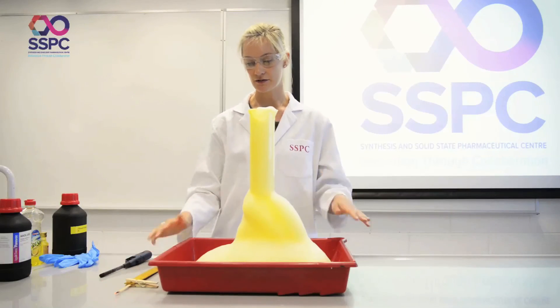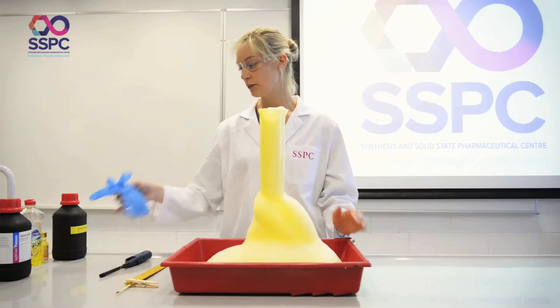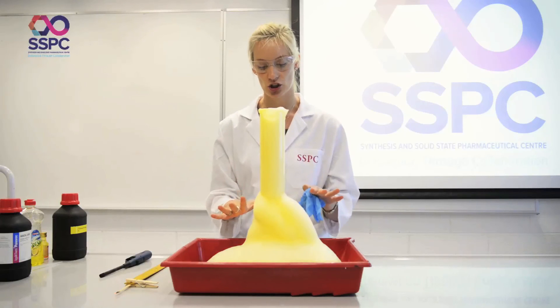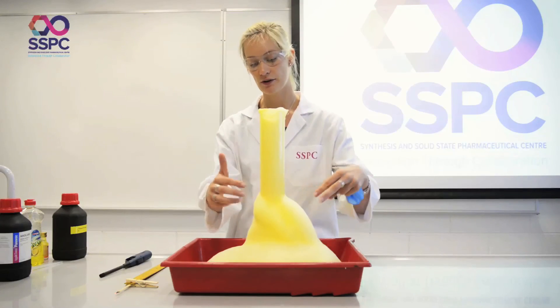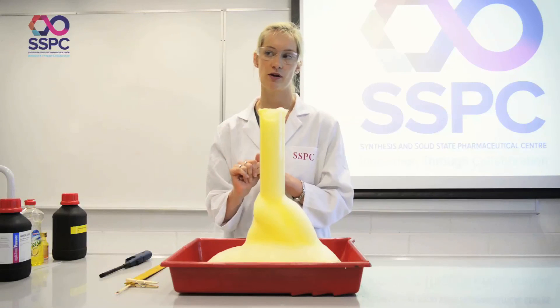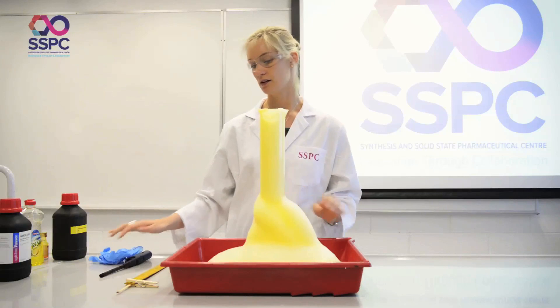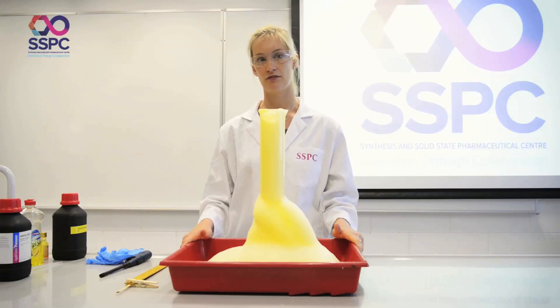In terms of safety, this is a relatively safe experiment. You can wear gloves, particularly if children want to come up and touch it — it's fine for them to do so, but because we do have some iodine as an intermediate there will be a brown stain on the hands, which doesn't look very nice but is perfectly fine. And that's the iodine snake or elephant's toothpaste.